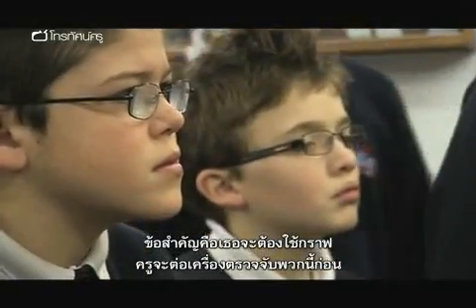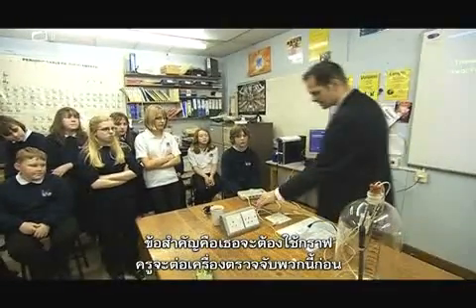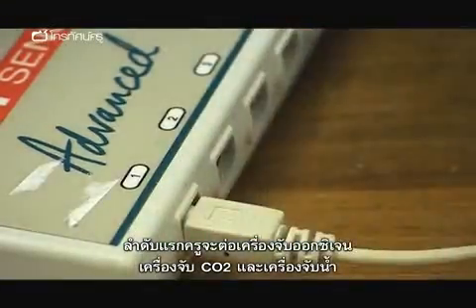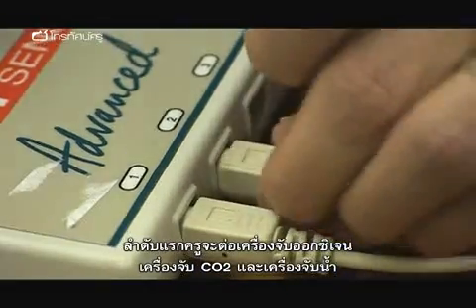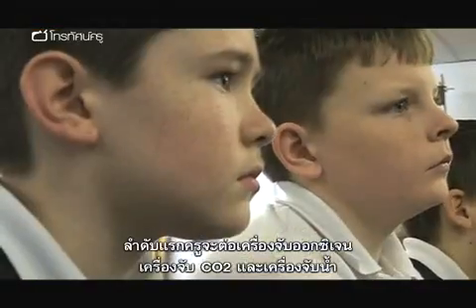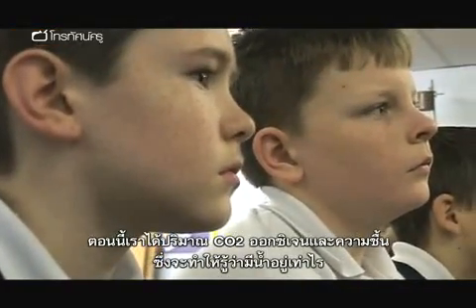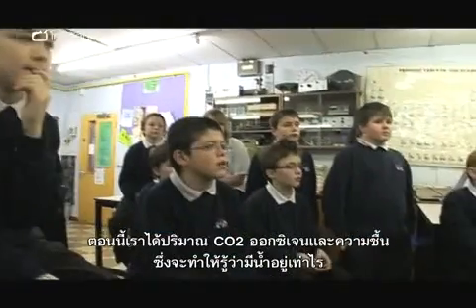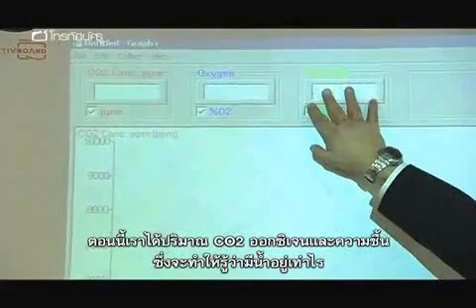That's the key thing here. Right. So I'm going to connect these sensors up first. I'm going to attach my oxygen sensor here, my CO2 sensor, and my water sensor. We now have the amount of CO2, the oxygen, and the humidity will tell us how much water there is.